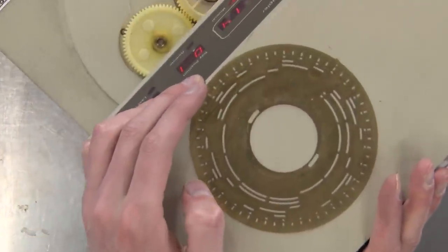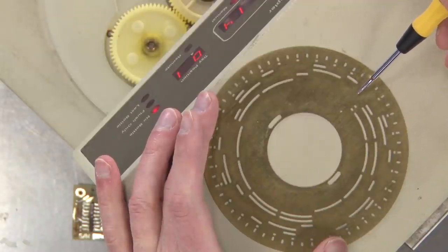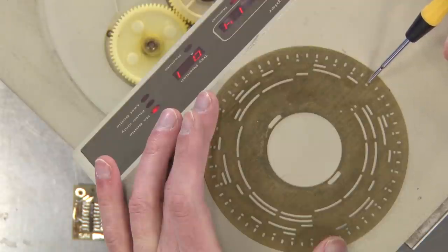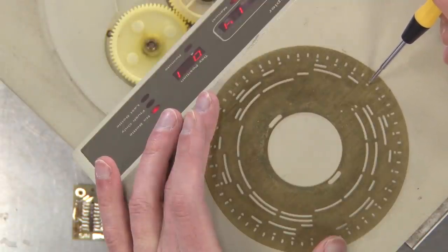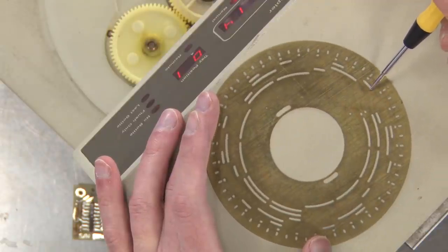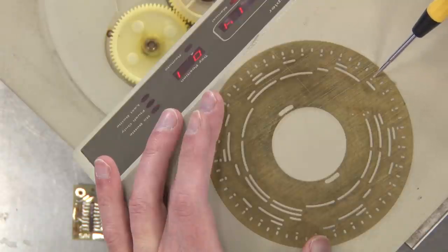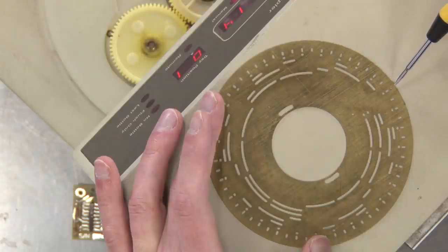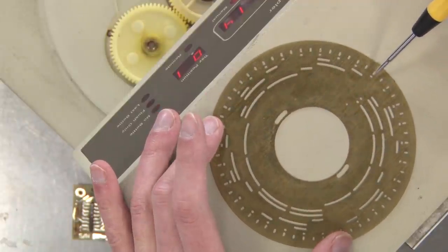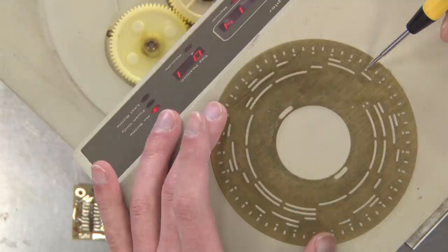Let's see if we can zoom in on the disc here. This is our position zero, straight across. And all we have is this outer mark in here. Now, the outer mark appears all the way around. So, this is our index to know you're at a hole. You've lined up. So, we can ignore these. So, we go here and we have a hole, one bar. So, there's one. And then we go here and there's two bars open. So, that tells us it's not binary.